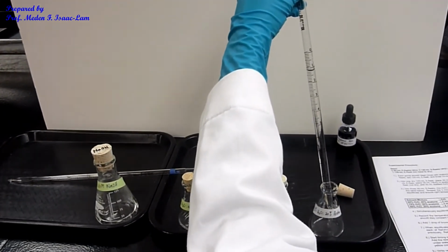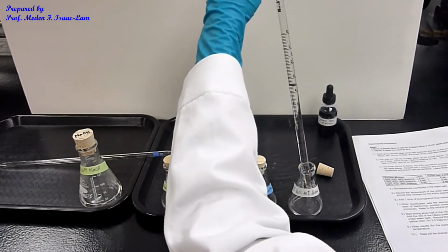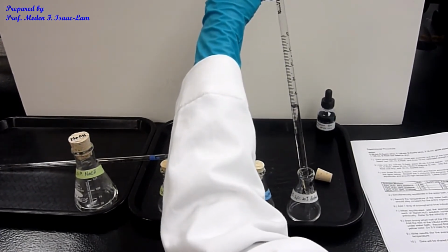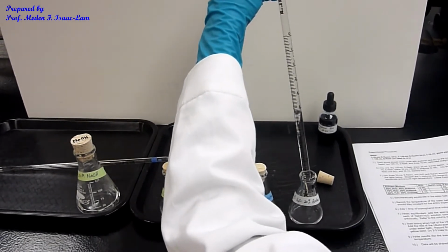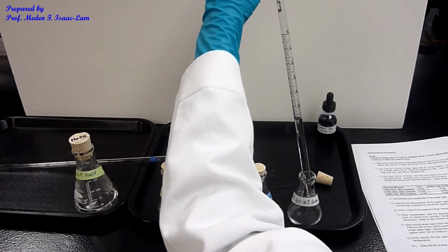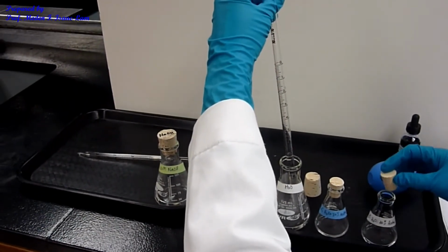So I have to stop at 6. All right, so those are my samples.